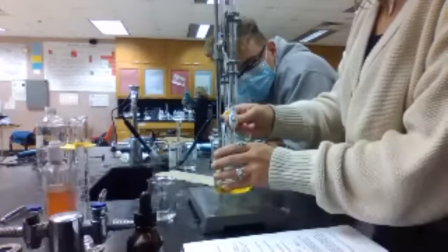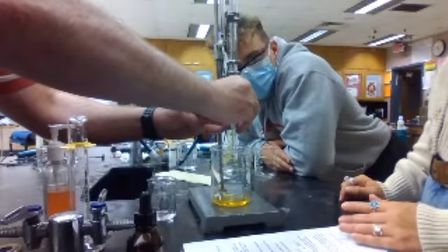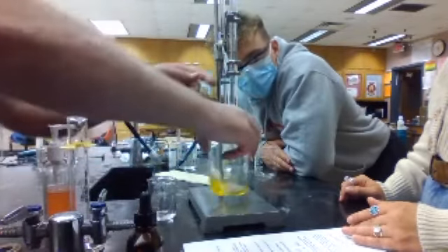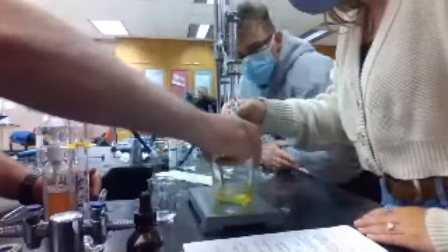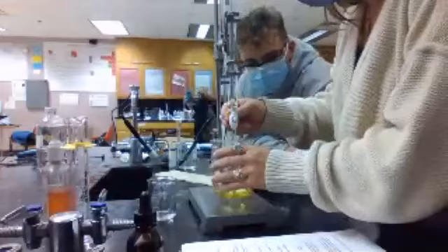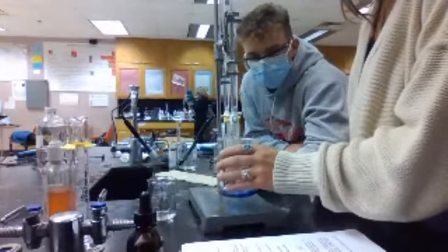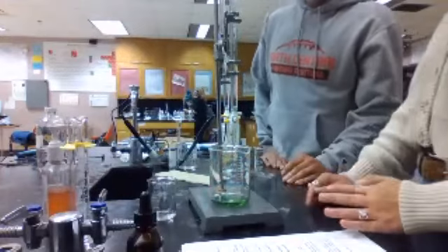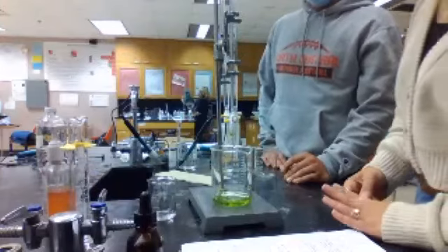So what you want to do is this. If we can get it so that it just drops, just like that, we can go like that. Get ready to stop it, because at some point you gotta do both. Right? Oof. That's it. Stop it. There it is. How many drops went in after it turned blue though, Peter? One or two? Oh, good. That's actually awesome. Okay, so that's right at the point.